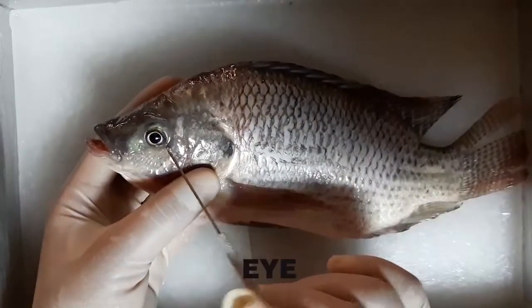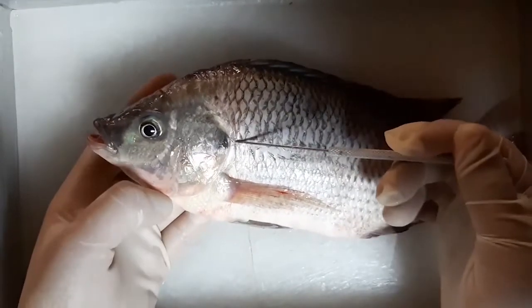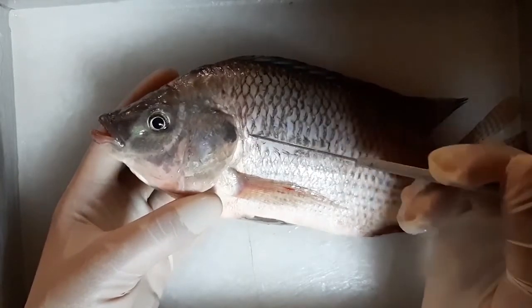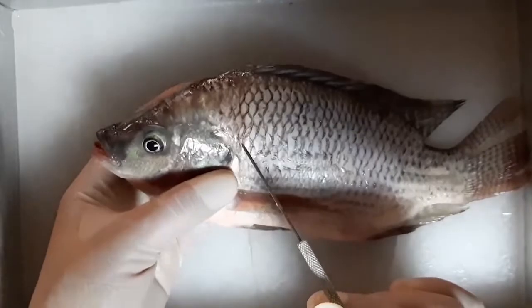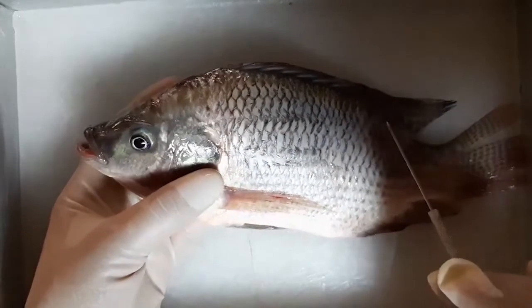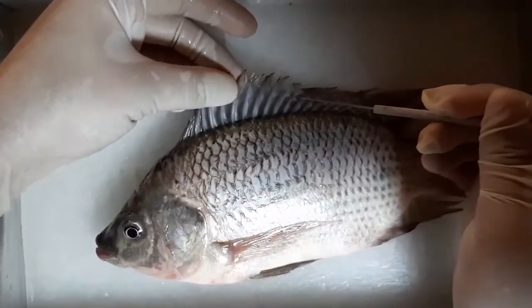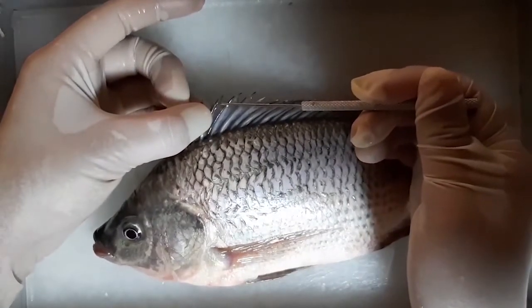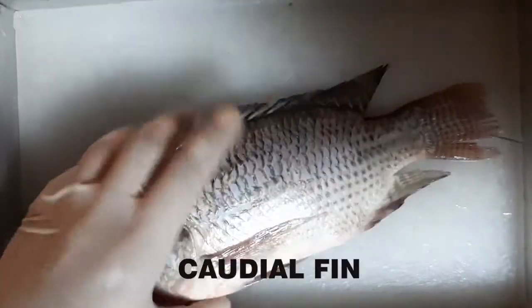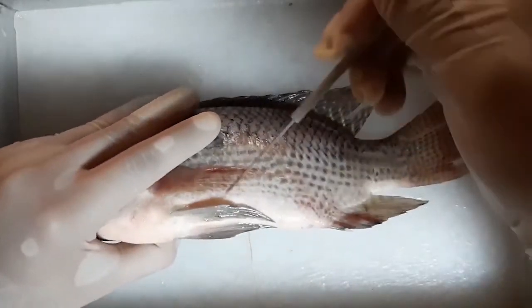These are the eyes, the scales that protect the fish from injury, the operculum that covers the opening of the gills. Behind the operculum is a line that extends into the tail. This is the lateral line. Pectoral fins, dorsal fins, dorsal spines, dorsal rays, caudal fin, anal fin, and this is the pelvic fin.